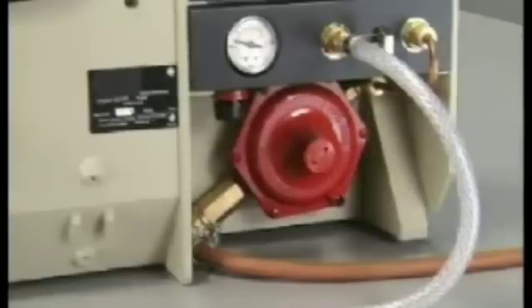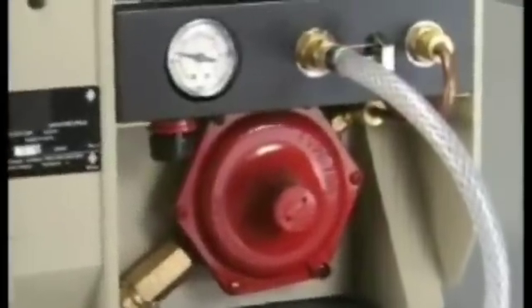Air and gas lines are attached to the back of the instrument. In this case, the air is supplied by a small pump. The gas supply passes through a secondary regulator valve before entering the instrument. Here the valve is painted red.